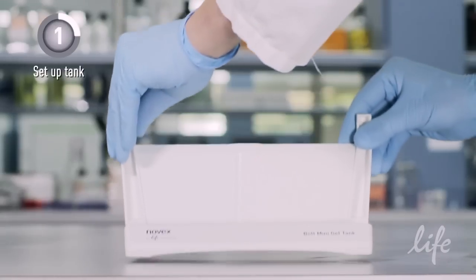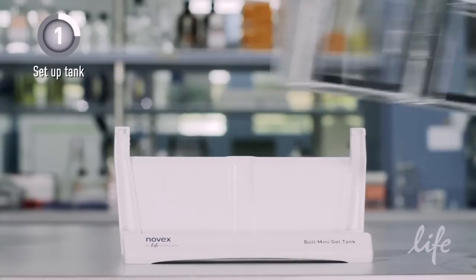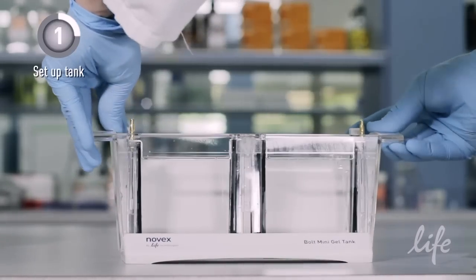To get started, place the Bolt Tank Stand on a flat benchtop surface, then snap the electrophoresis tank into the stand.